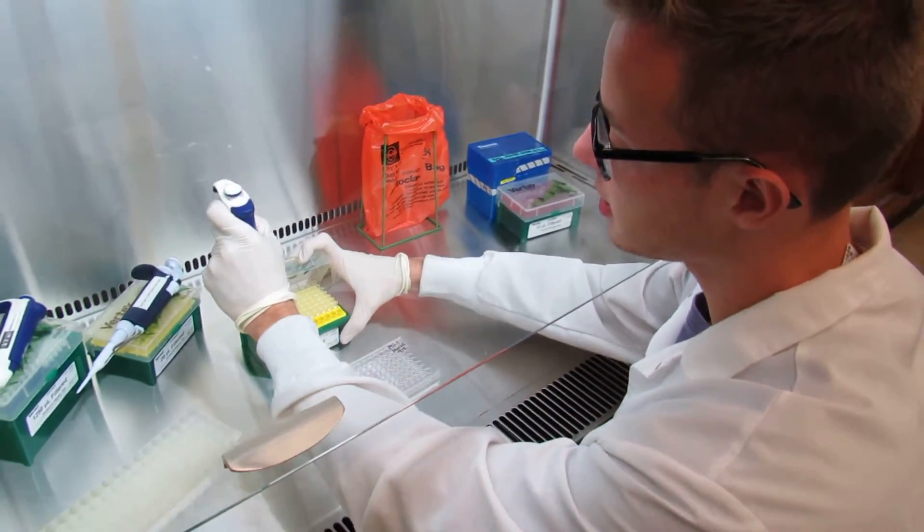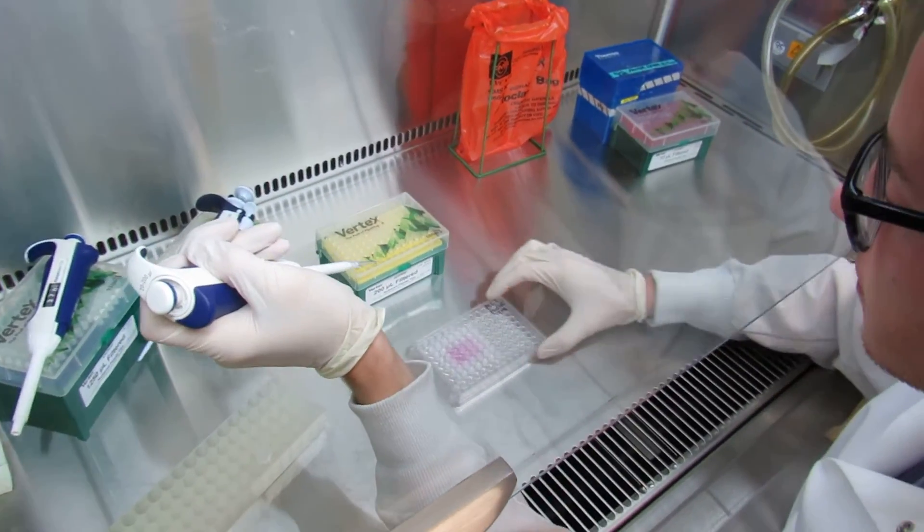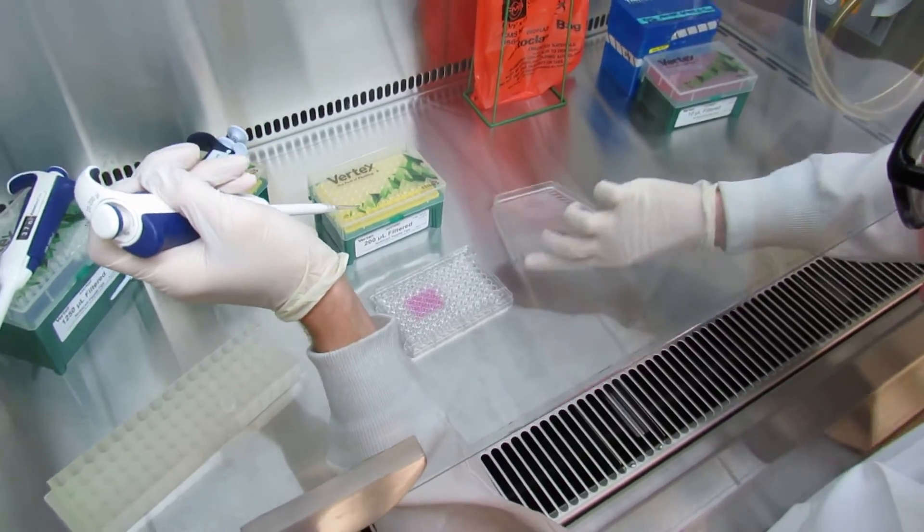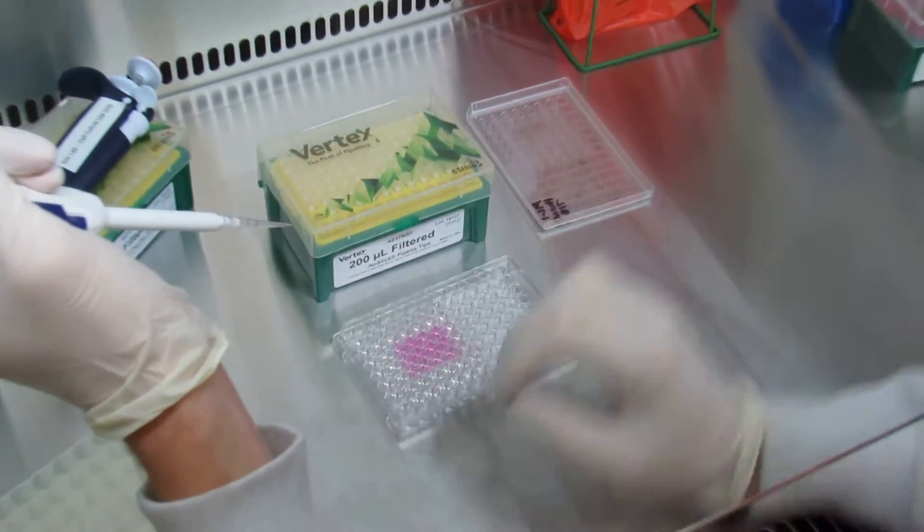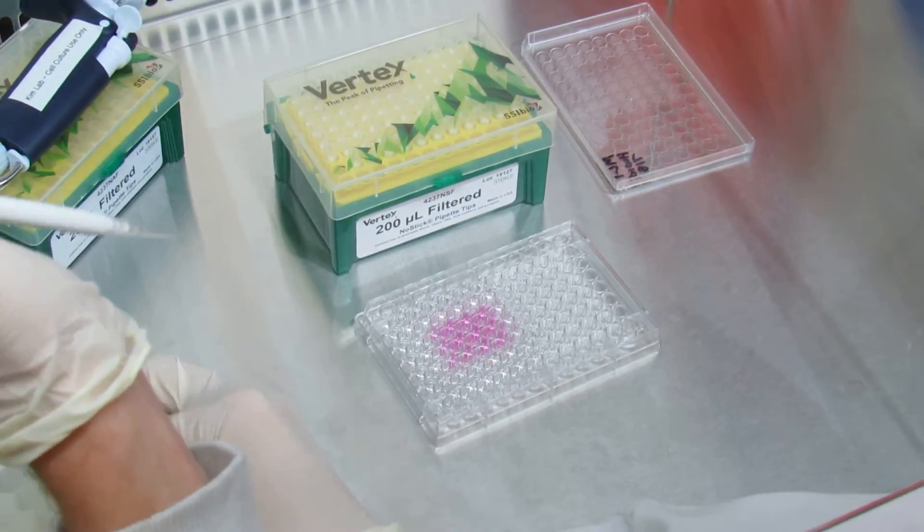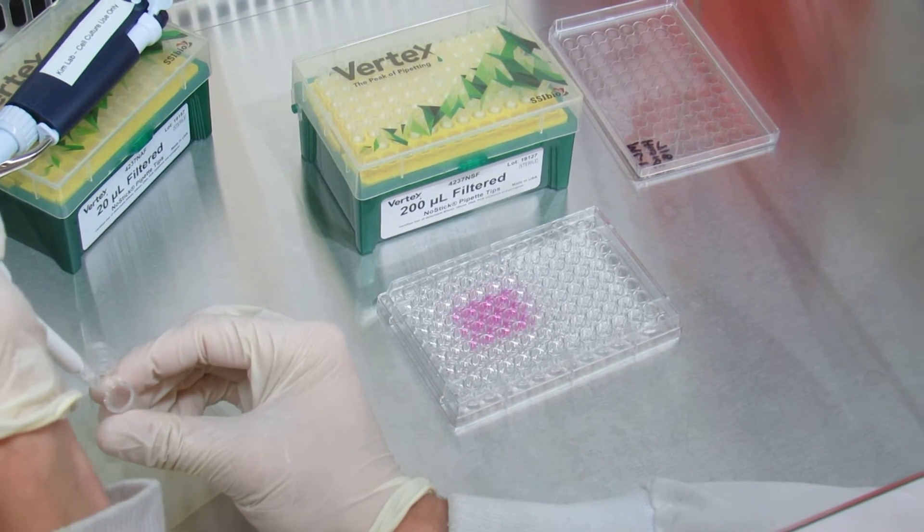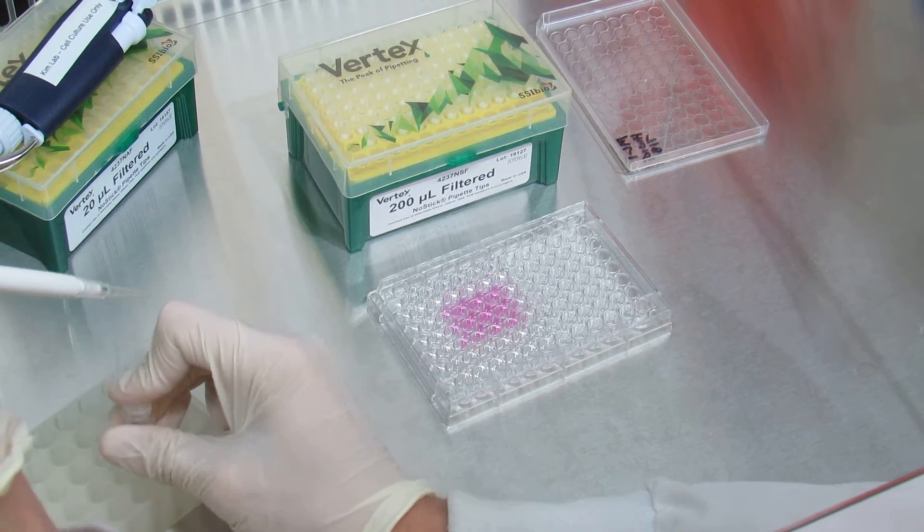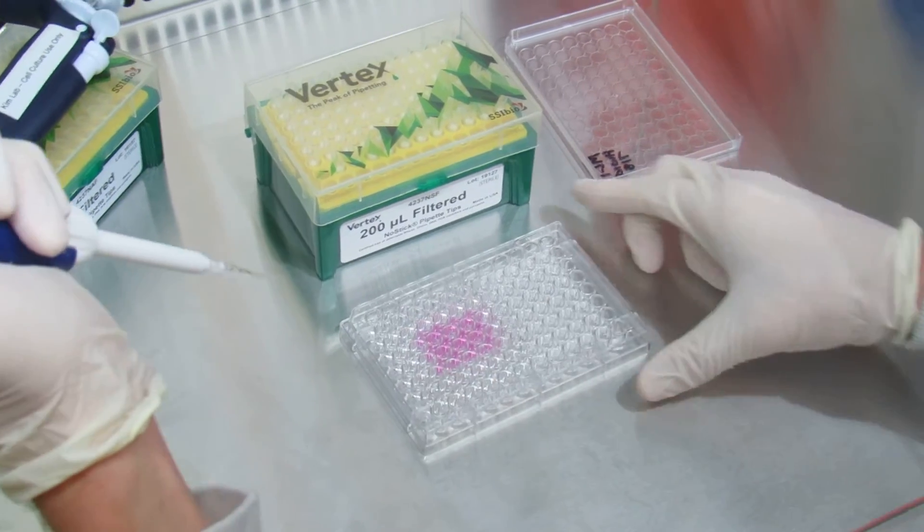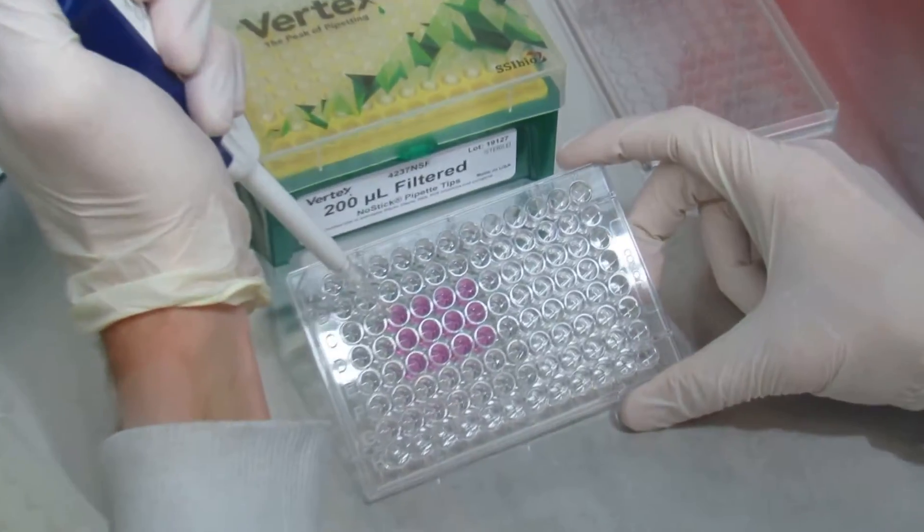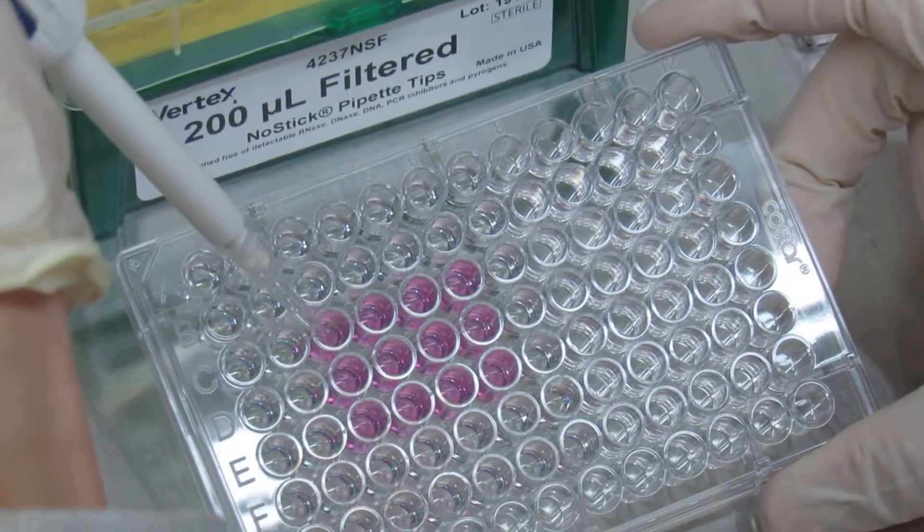So we will take our tip and we will set it like so. Make sure you don't have any bubbles and you will add the dye directly into your solution.